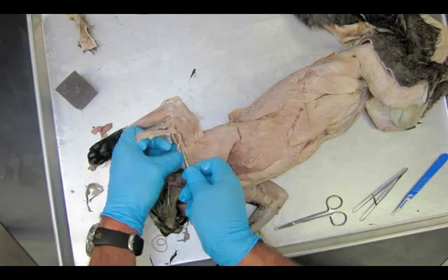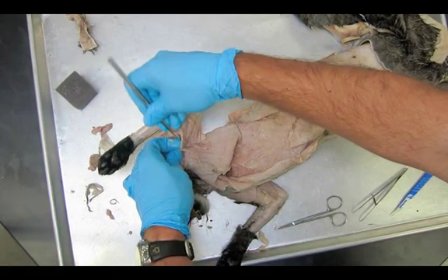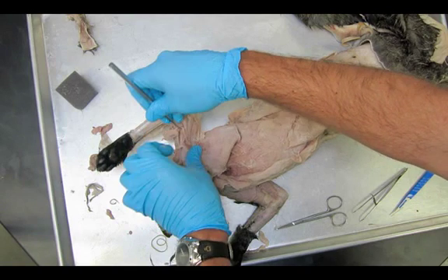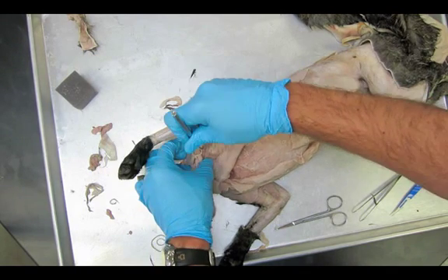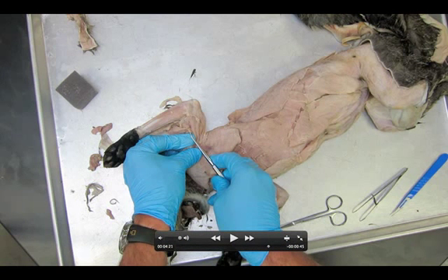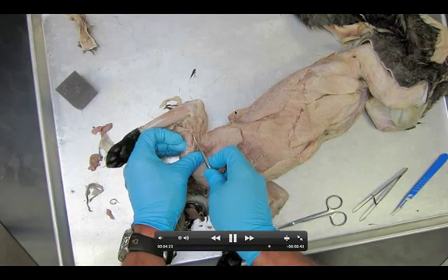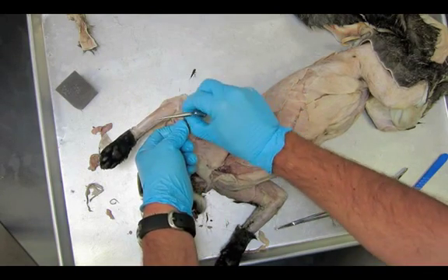Higher on the arm we see the biceps — the official name is biceps brachii. To find it, lift up the pecto-antibrachialis and carefully pull some things away. Notice how I'm getting my probe underneath this big wide flap of muscle — I don't want you to tear it off. See my fingers getting underneath that flap right here? That muscle is called the epitrochlearis — don't tear it off, that's a mistake many people have made.